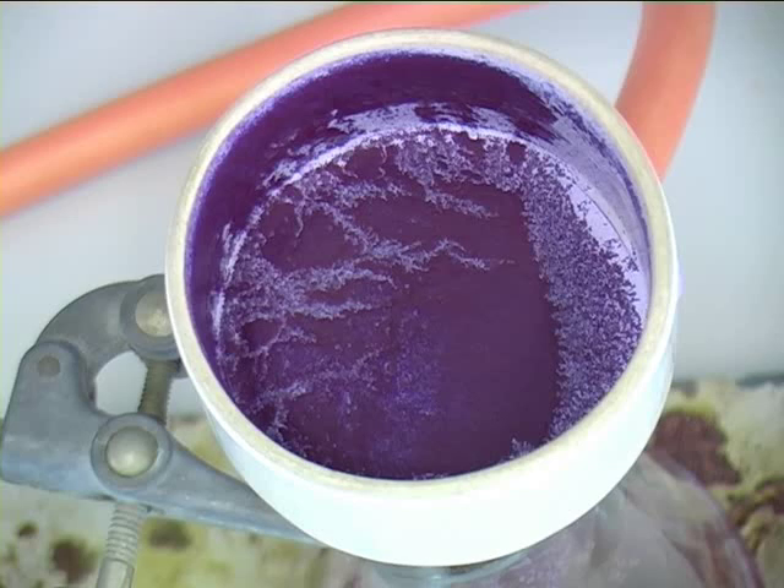This is how it would look after the filtration is complete. As you can see, all the solvent has been filtered off.